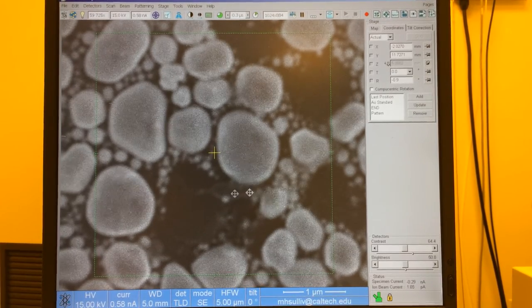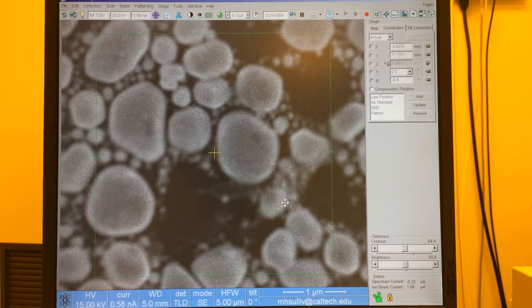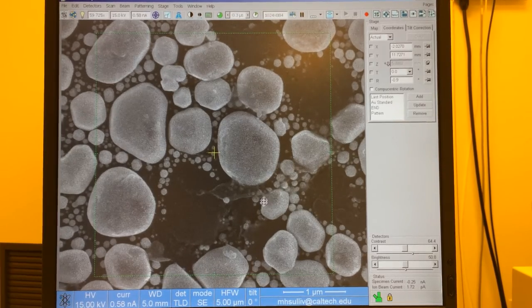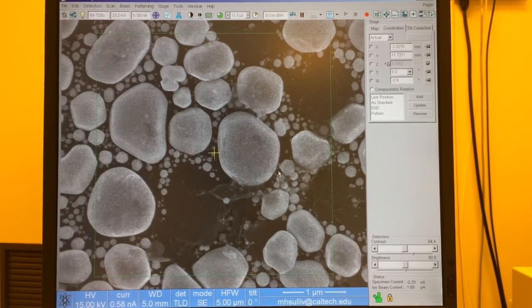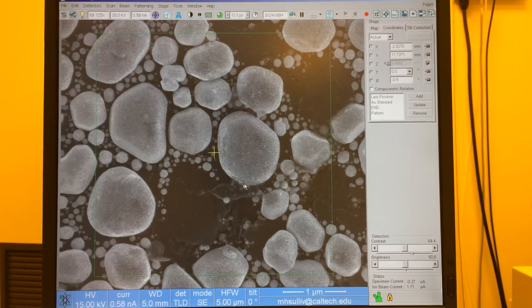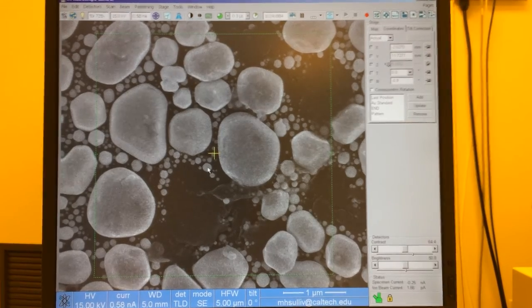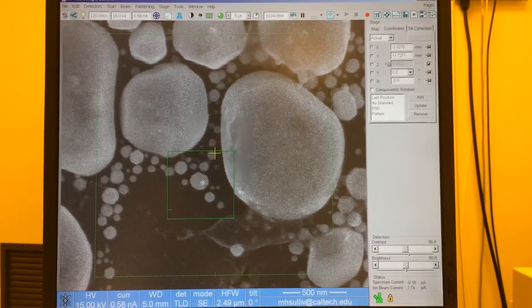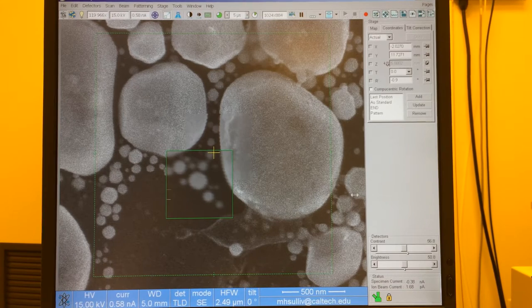Now I'm going to adjust the X and the Y astigmatism, and you can see as I'm doing this, I don't see any stretching while I'm adjusting astigmatism, which tells me that I'm definitely on the right focal plane, and I can iterate that process as much as possible, as many times as I need to. I can zoom in, I can use a reduced window, I can look at smaller particles, and again, focus left and right, look for stretching, stop in the middle, and fix the astigmatism.